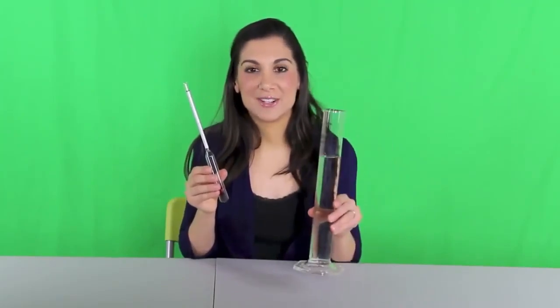Hydrometers are very fragile and must be handled carefully to avoid breaking. I will be using a glass cylinder as the test tube.